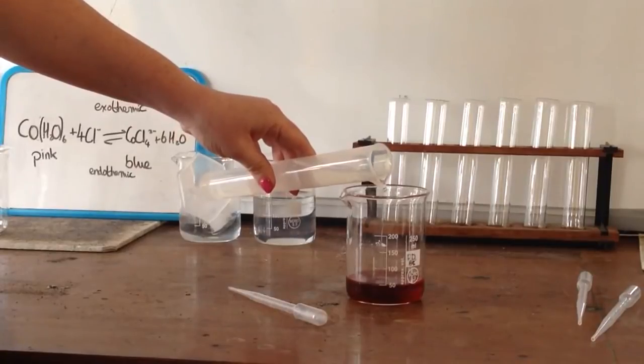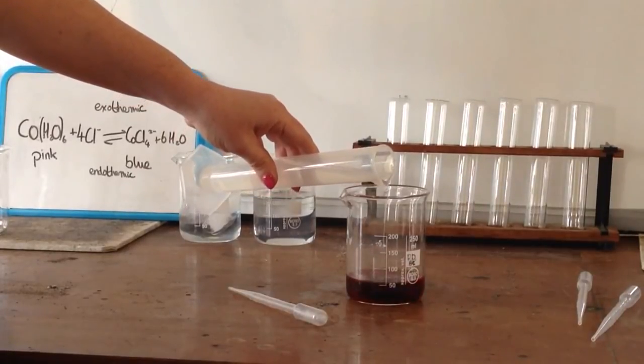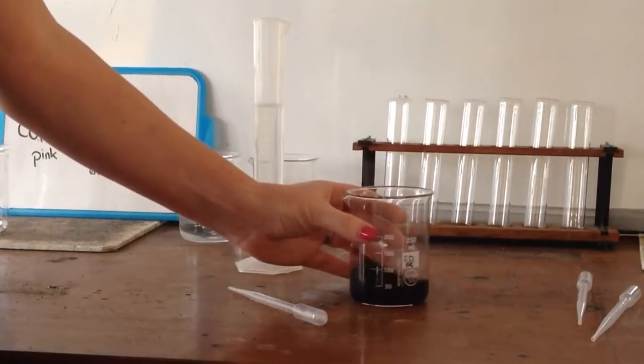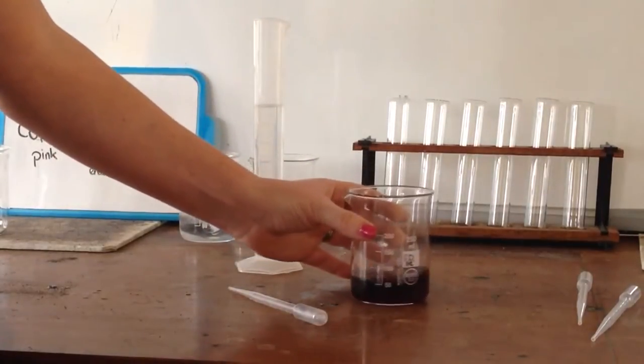I'm just going to slowly add that in and I'd like you to pay attention to the color that it goes. So you can see it's starting to change color.